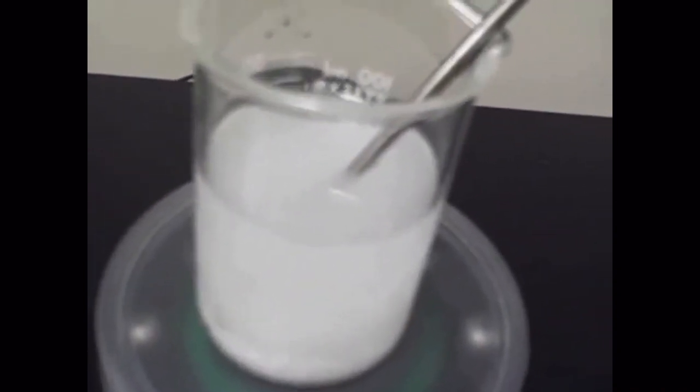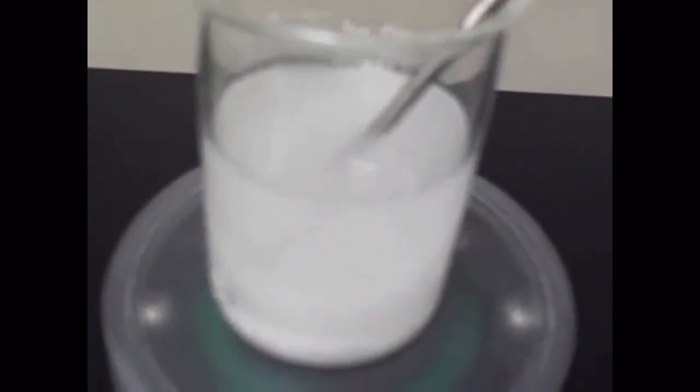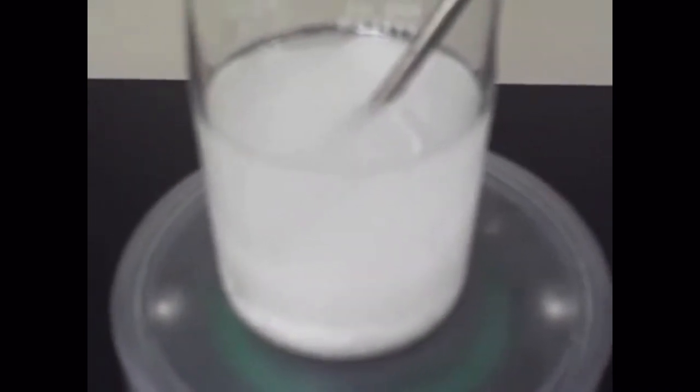So I'm going to stir it a little bit just to get it moving around, because we can see that there is indeed a temperature change when we put the solute into 50 milliliters of water. So at 80 seconds, that's the next reading I'm going to do. And now I'm going to get 47.7 degrees Celsius. Again, so at the 80-second mark, you are writing this in the data table.